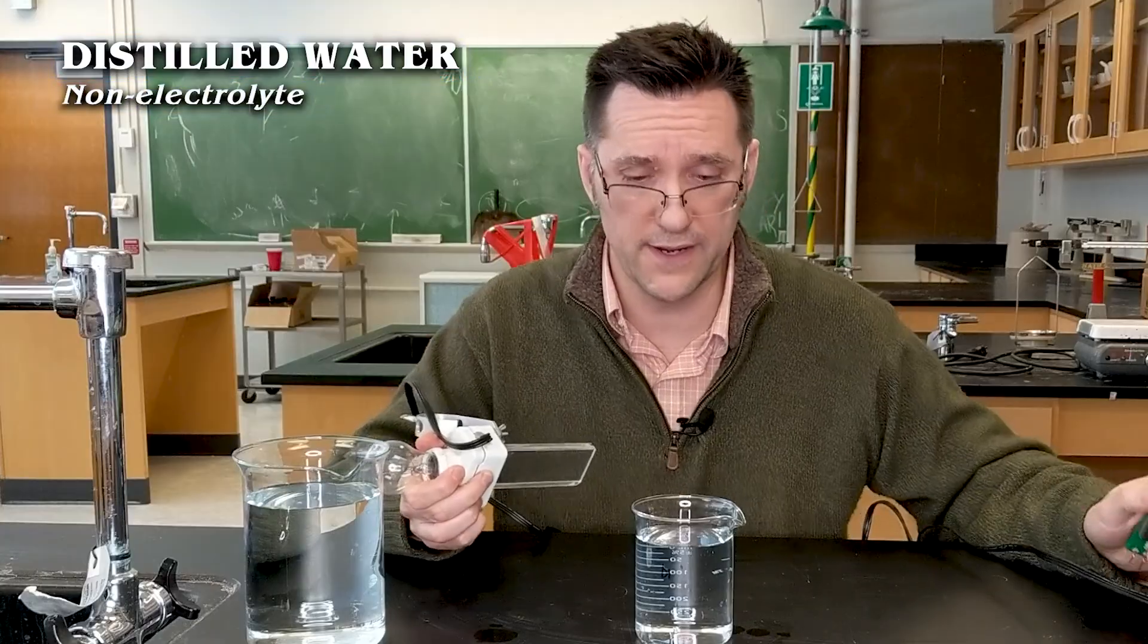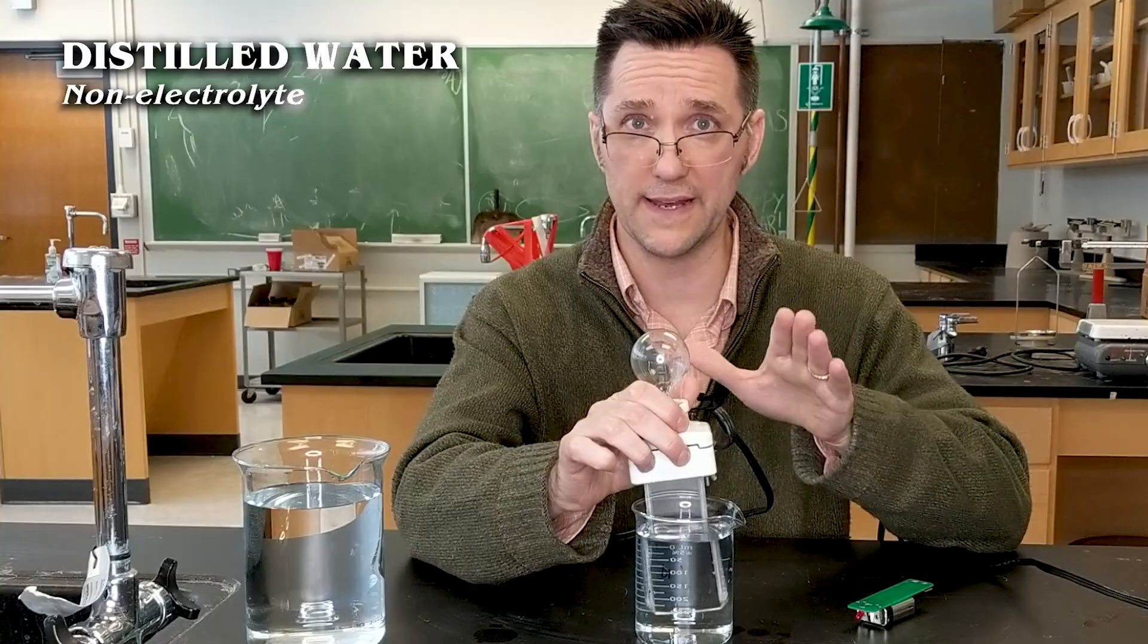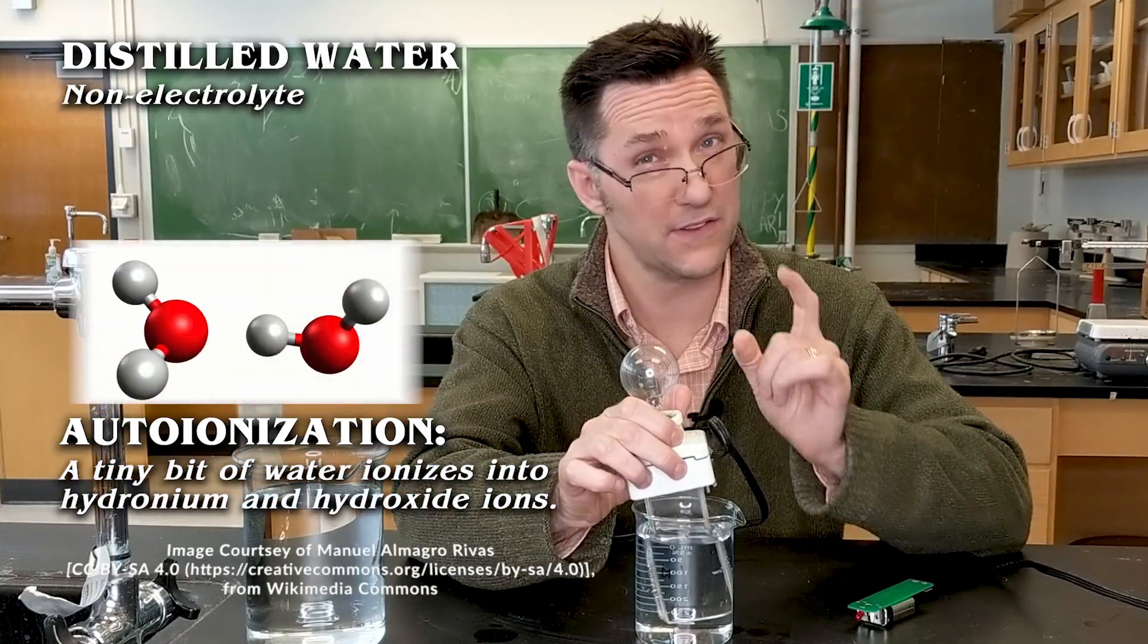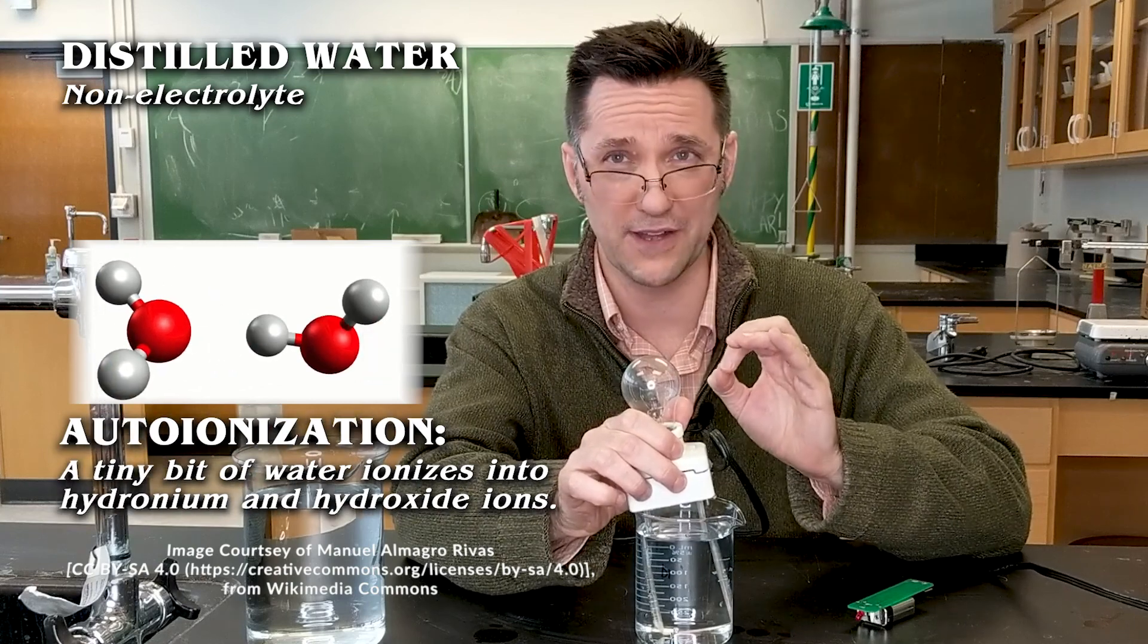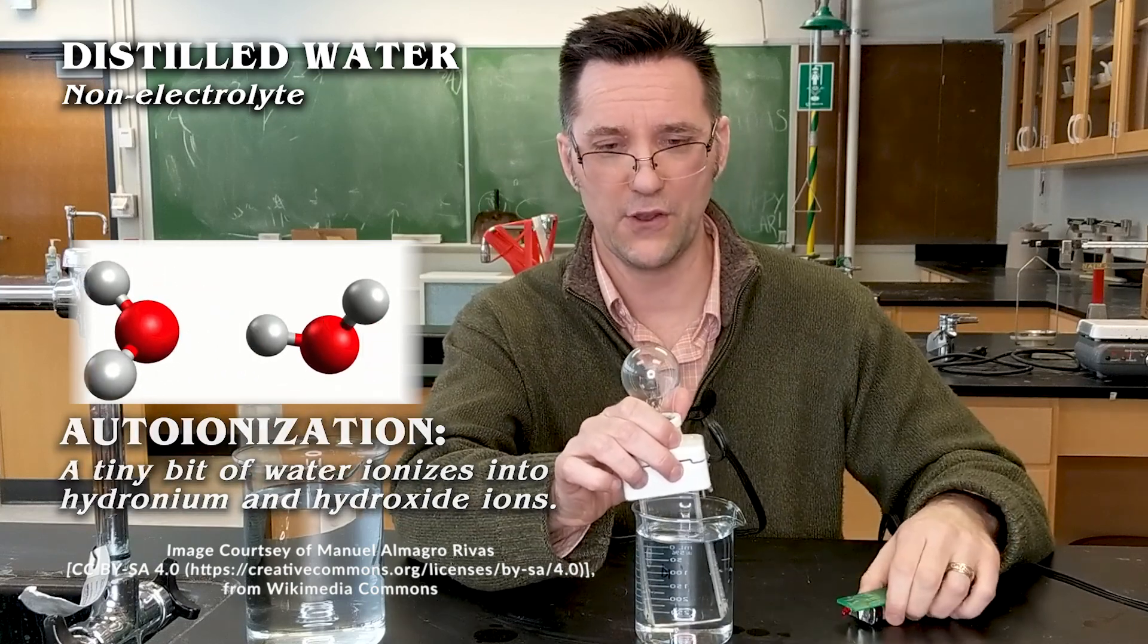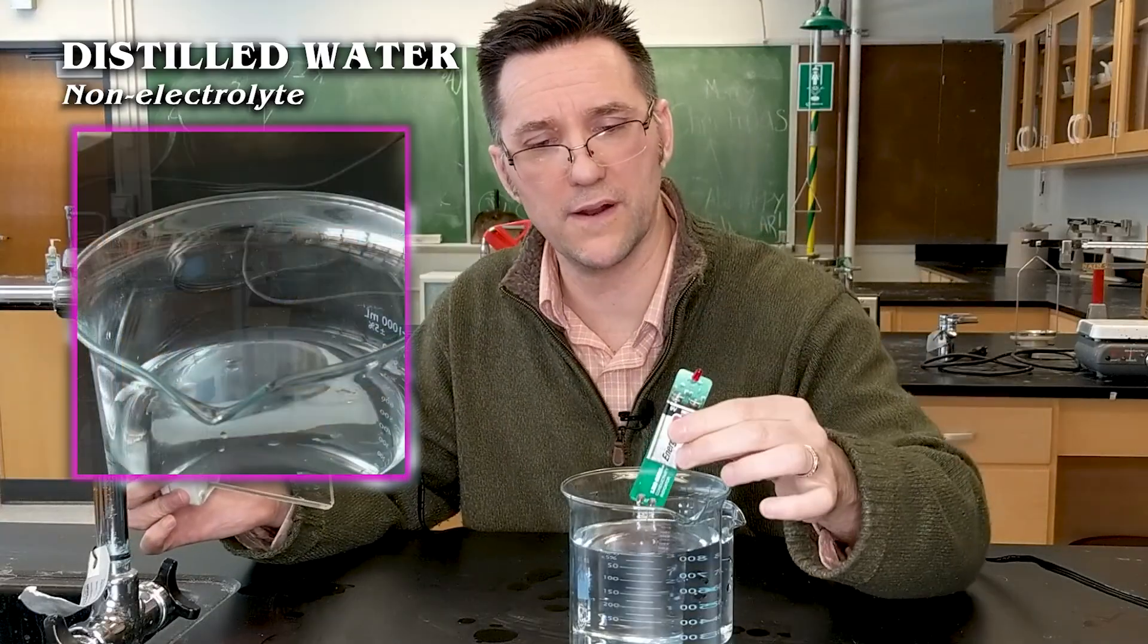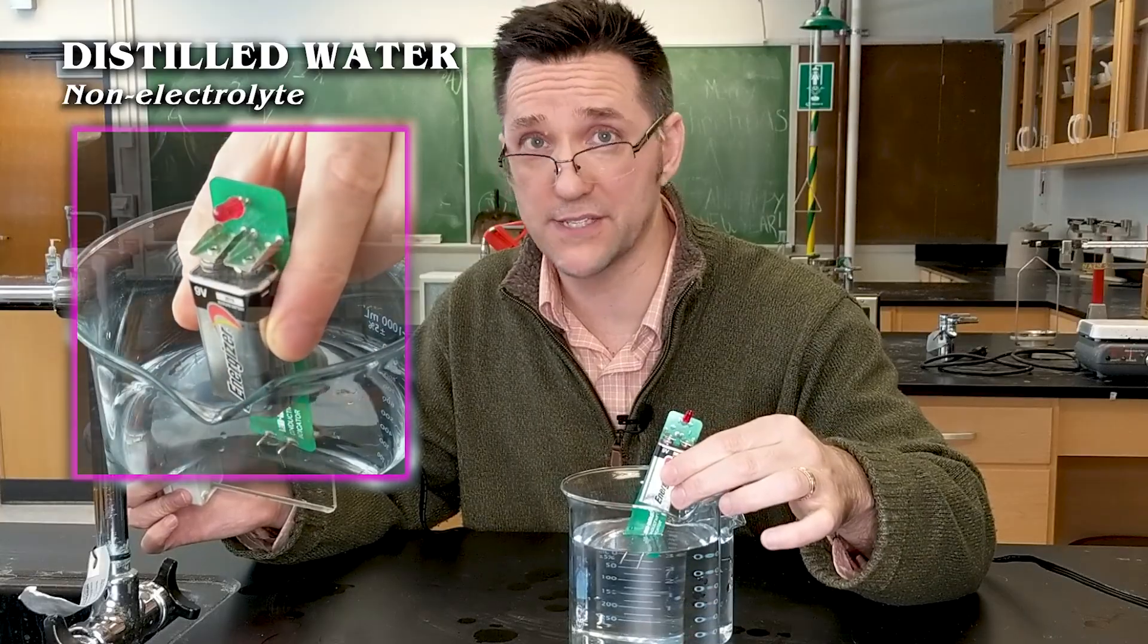So we'll start with distilled water here. Even if I put this big one in, it's plugged in, but it's not lighting up. Pure water actually has very little ions in it. There's a little bit of autoionization, so very little of the solution is autoionizing. And so we just don't get enough ions in there. So if I put in this big beaker of distilled water, I can't see anything blinking right here. Although it doesn't take much ions to corrupt distilled water.